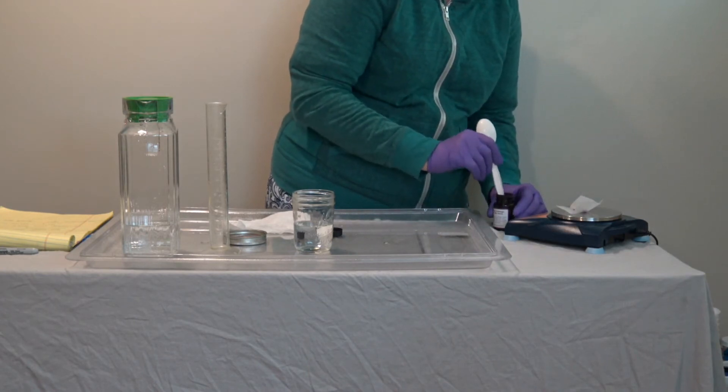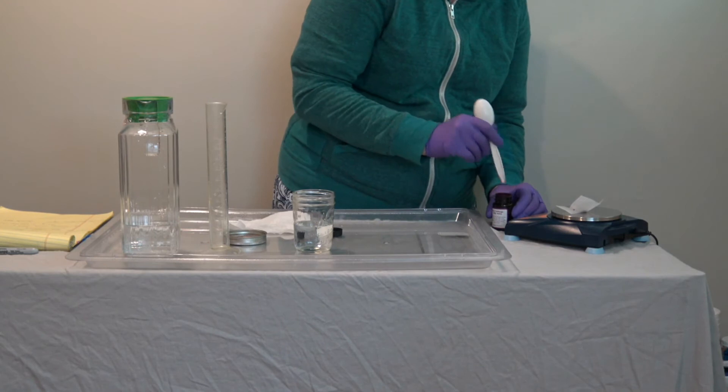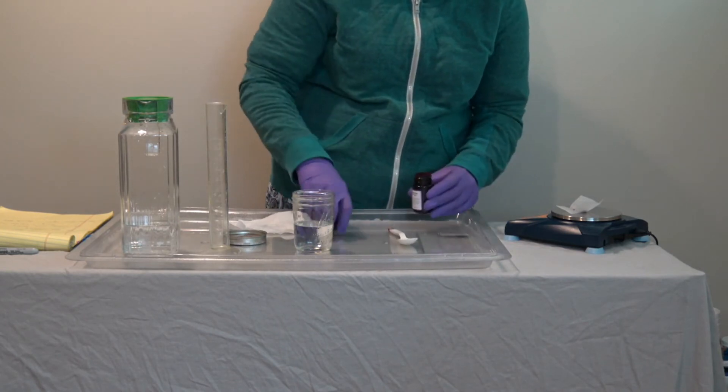I'm going to try to knock the excess off into the bottle.